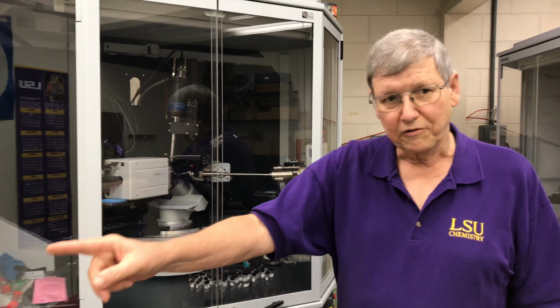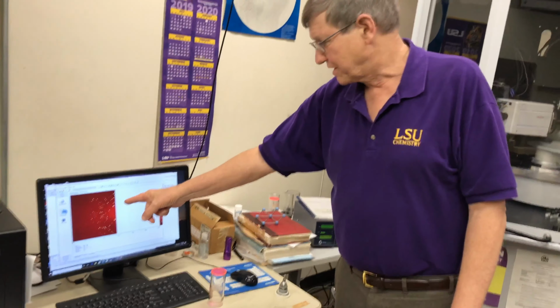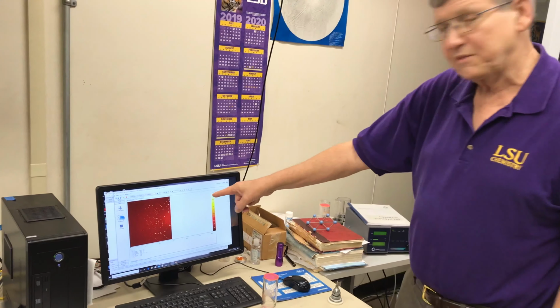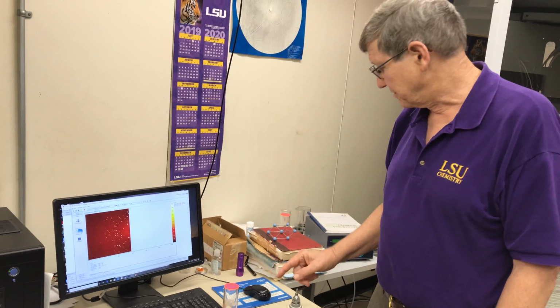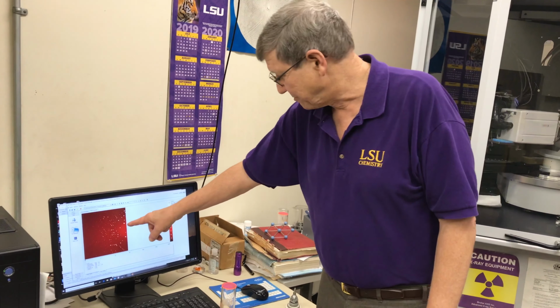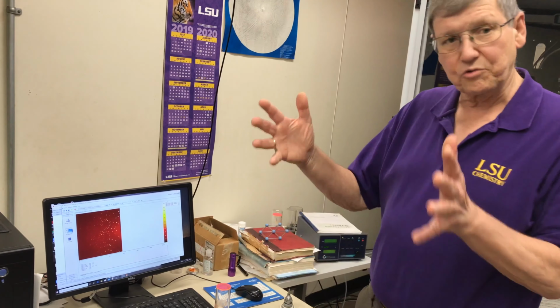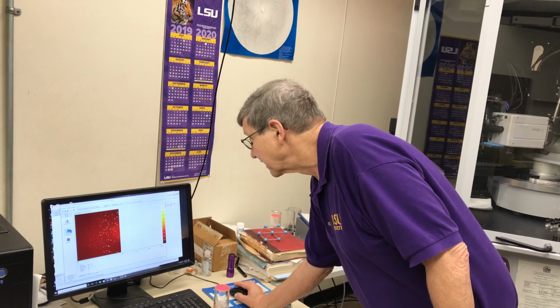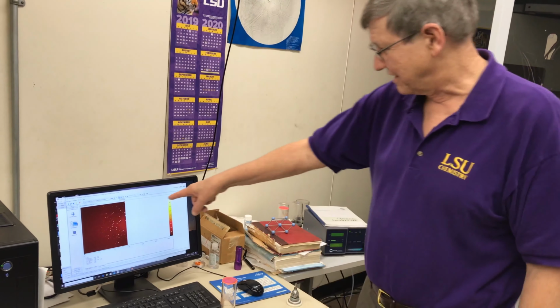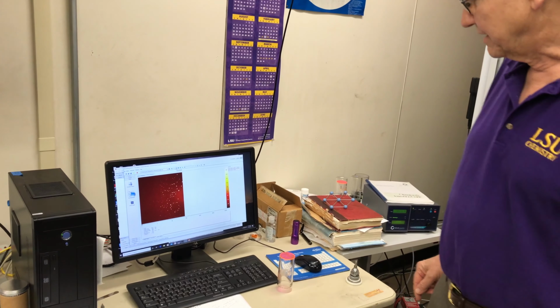Now, if you look over here, you'll see the image from the detector on this diffractometer, and you will see there are lots of spots here, white spots. Some of them are very bright, some of them not so bright. There's a wide range of intensities, and we measure tens of thousands of these. I'll put this on a little kind of movie thing, and you'll see all the different images we've gathered there.